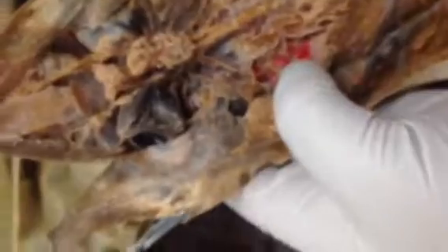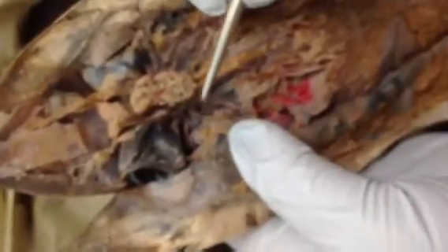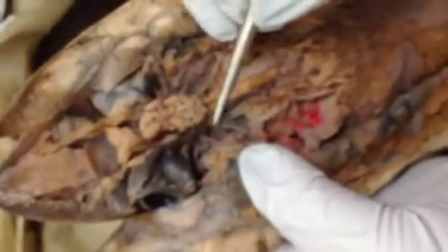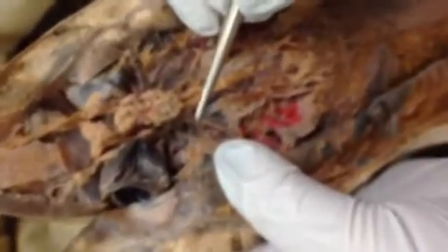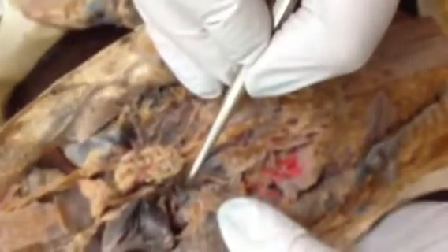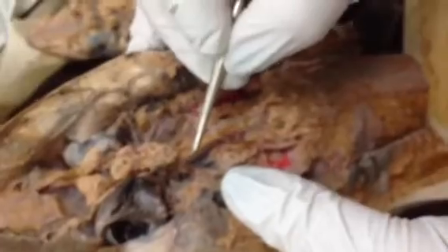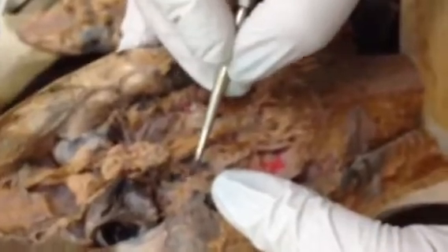This one — hyomandibular nerve. Hyomandibular nerve is this one. Before the vagus. Yes, okay. And we need the geniculate. This one. And you need the statoacoustic nerve. Okay. I think it's here on mine.